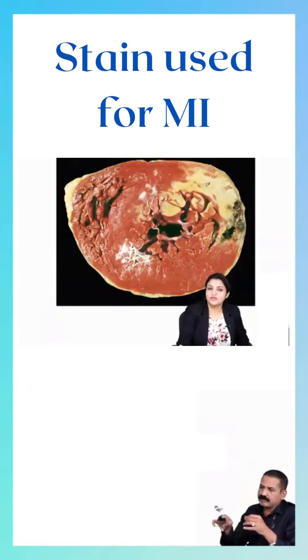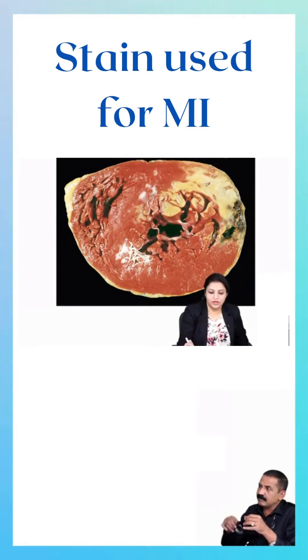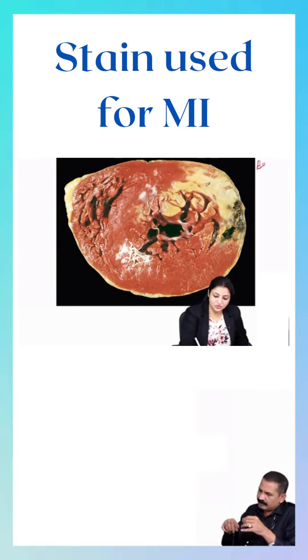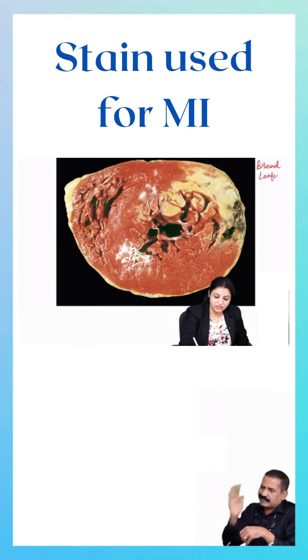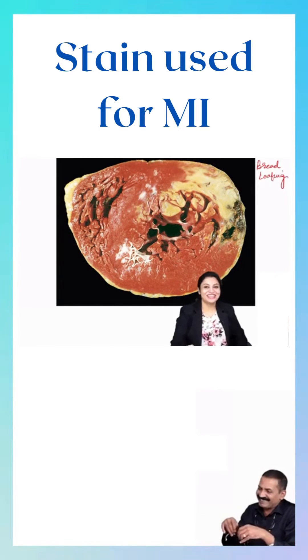Let me show you an image of it. This is the section of the heart — just like I told you, bread loafing. I hope everybody understood what I meant by bread loafing — slicing the bread.